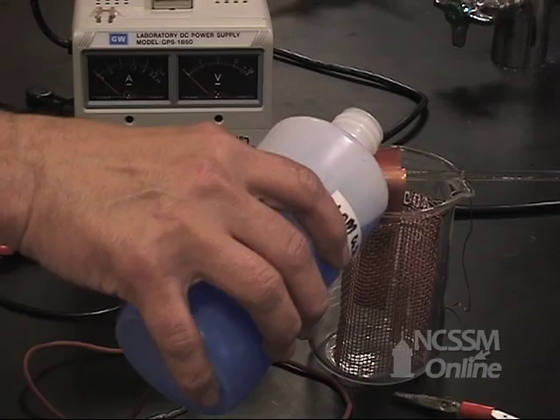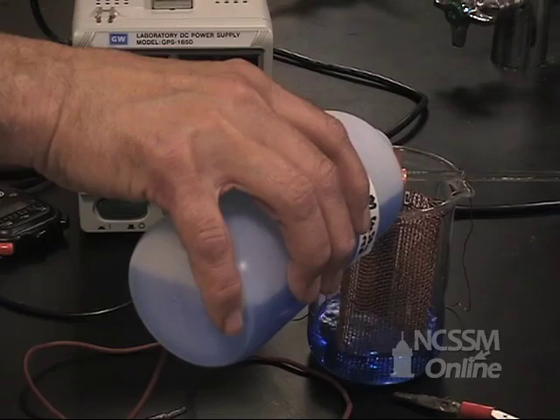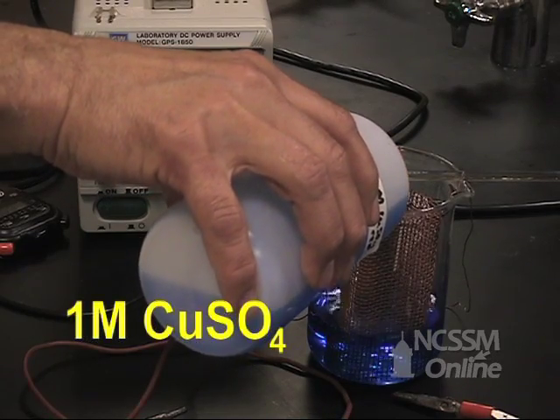We're going to fill the beaker about three-quarters of the way with one molar copper sulfate solution.